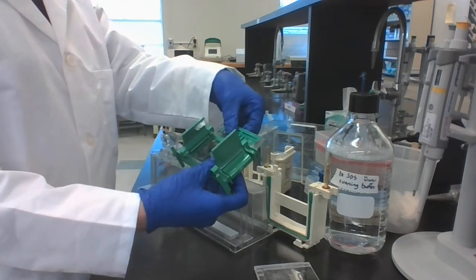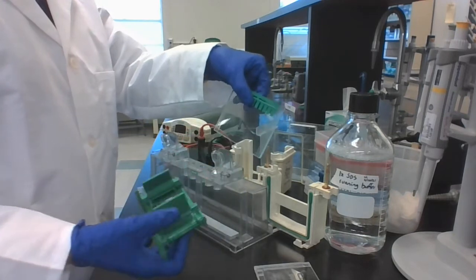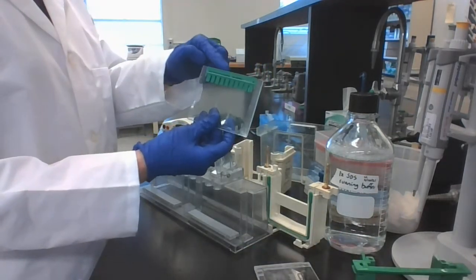Hold on to it, and you can take it out either the top or the bottom. That doesn't matter. Leave the comb in for now.